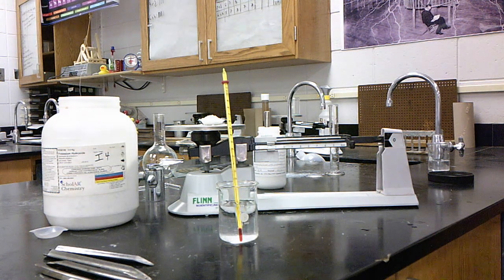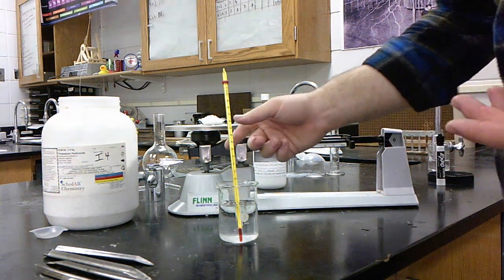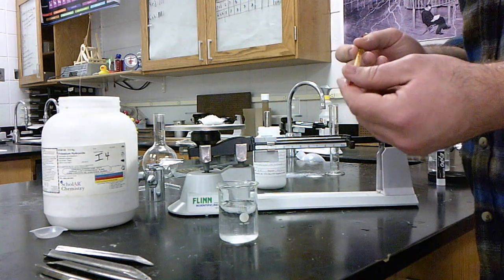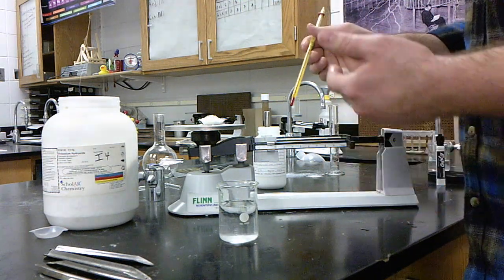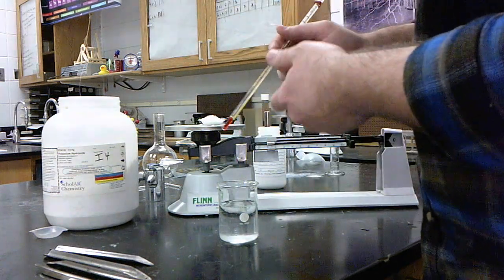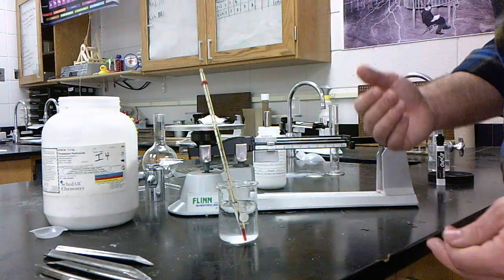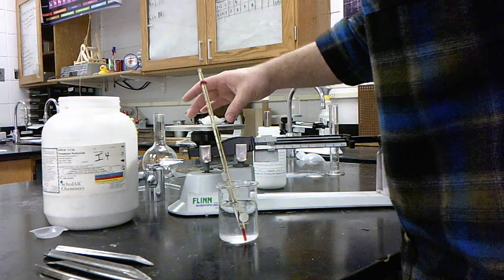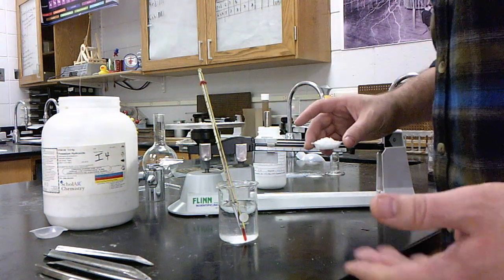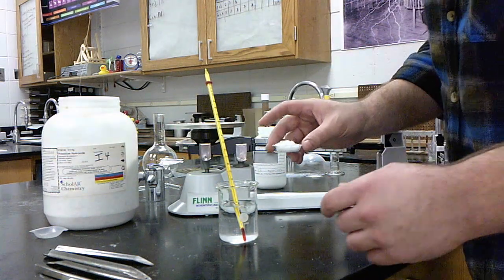Now, if I know it's going to be 22, why would I check it? Well, there could be something going wrong with the thermometer. There could still be that dissolving reaction happening here. And if it was colder than my other initial temperature, then that would tell me, hey, I need to make sure I clean this off a little better before I start. Because otherwise I'm going to get a false reading on my final temperature. So it's less about double checking that the room temperature didn't change, and more about making sure my thermometer is ready to go again.